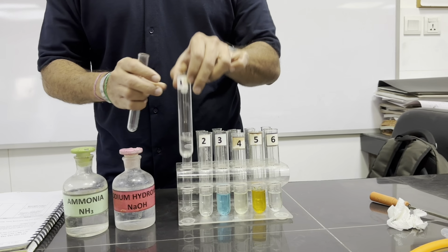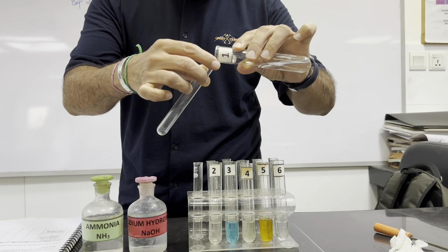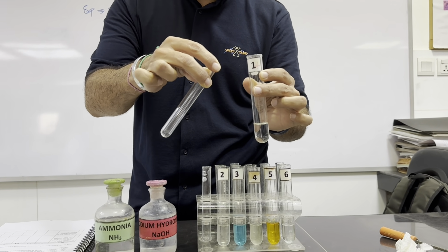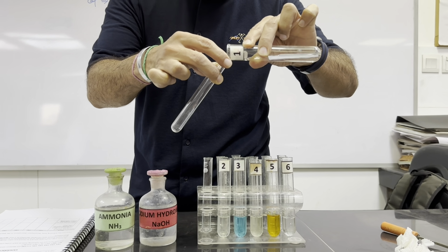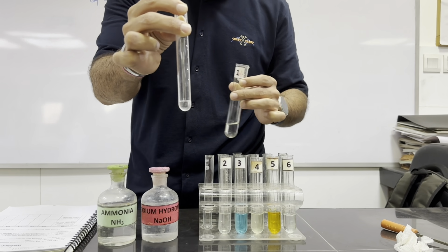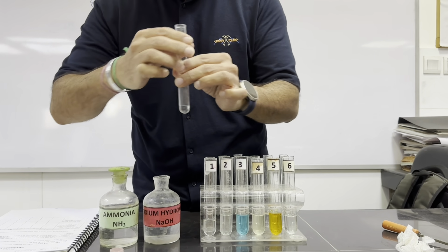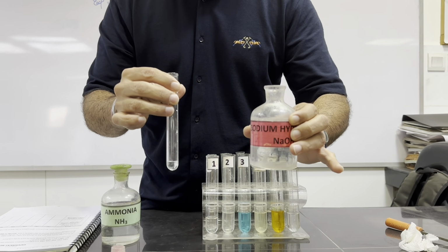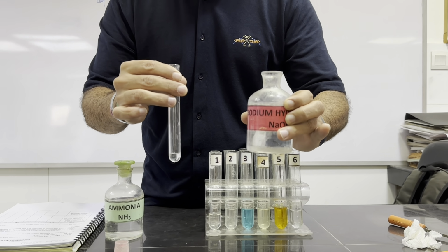So we are going to test our first chemical given. We have taken its first 1 centimeter, but we will make sure that we do not add it like this. We will tilt this tube a bit so that it will not splash. Slowly we add 1 centimeter depth of this solution, and now you can see it's almost 1 centimeter depth. Now we will add sodium hydroxide in first few drops. Few drops could be any number of drops because these solutions get diluted with time. Therefore, we will add few drops until we see a change.